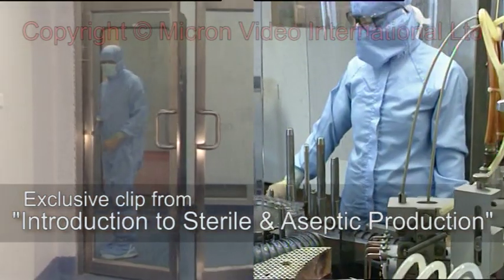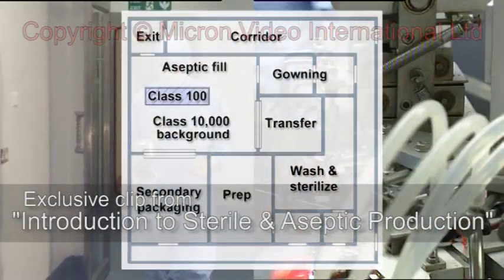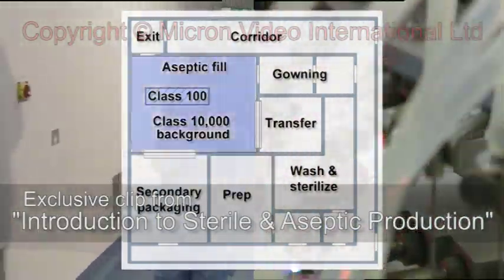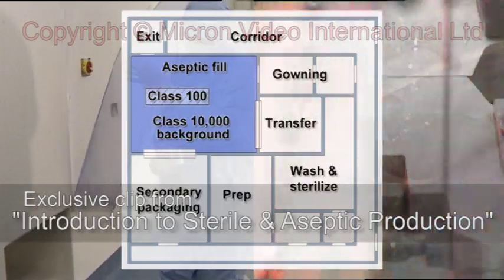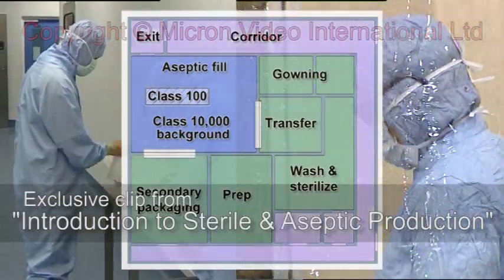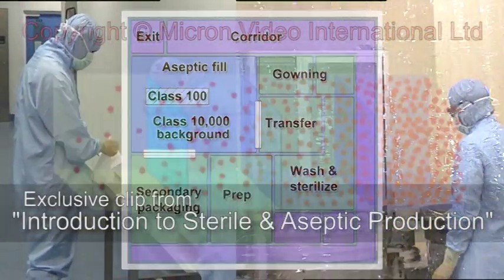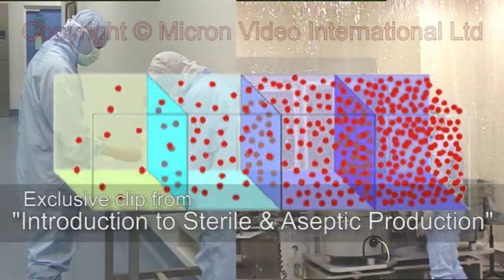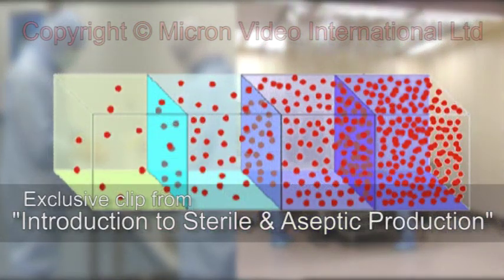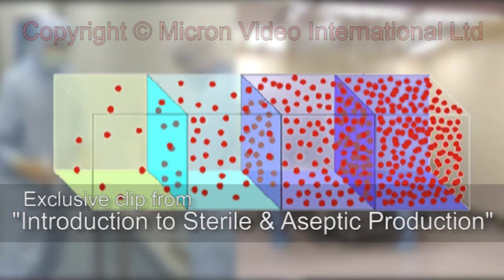Each area in a clean room and the surrounding environment must meet specific standards of air cleanliness. This is called clean air classification and refers to the amount of particles and microbiological contamination permitted in a specified volume of air adjacent to specific operations.